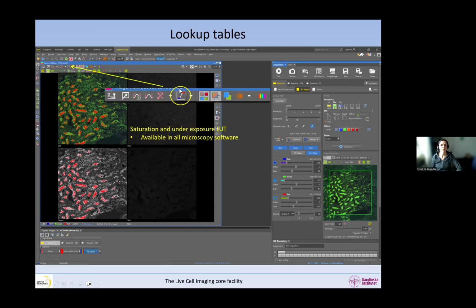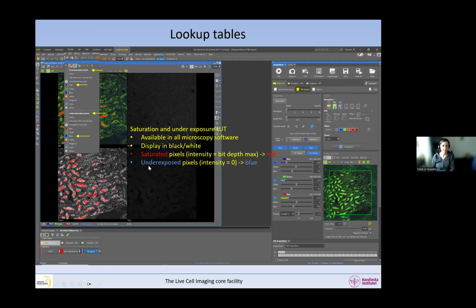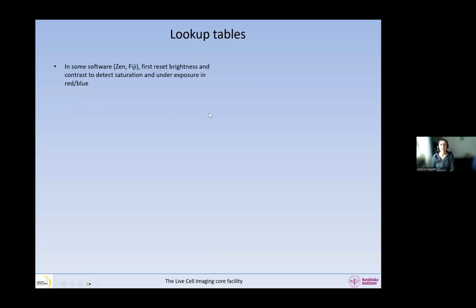So in the Nikon software, it's this little button here that shows the blue minimum and red maximum. And when you click on that, the images, if you have not displayed them in black and white before, but you should, they become black and white. And also it shows the saturated pixels in red, and that's the maximum bit depth. And it shows the underexposed pixels in blue, and that's the pixels that have an intensity of 0. And you can change this in the software if you want to put different colors or something.